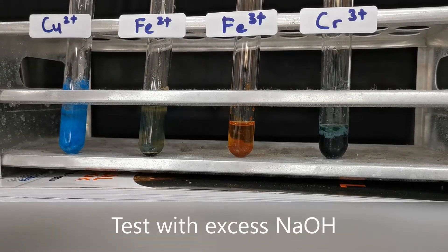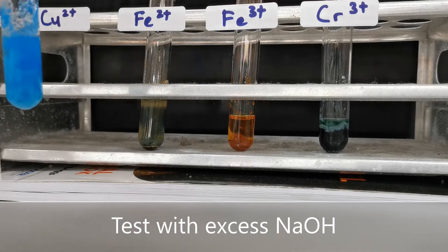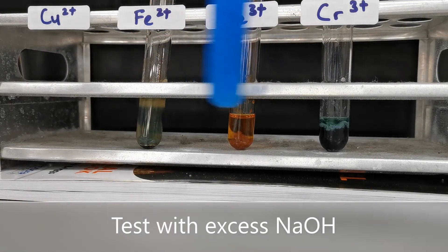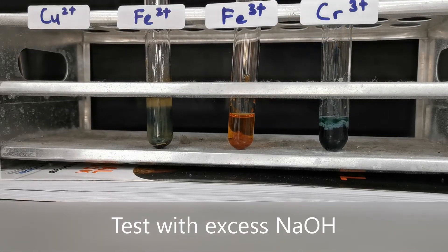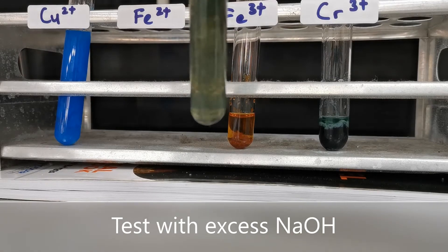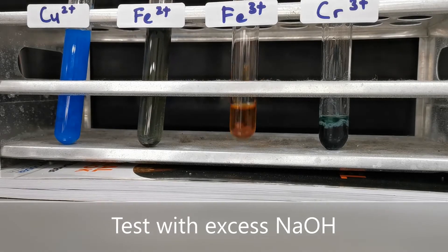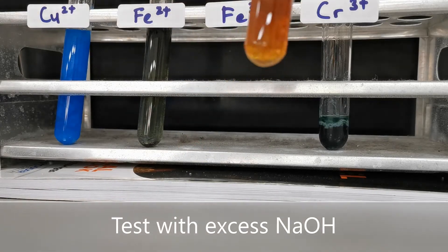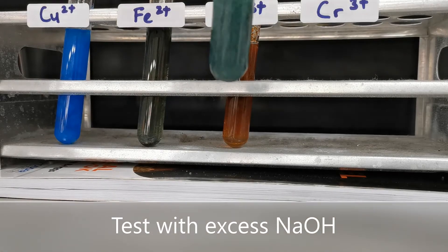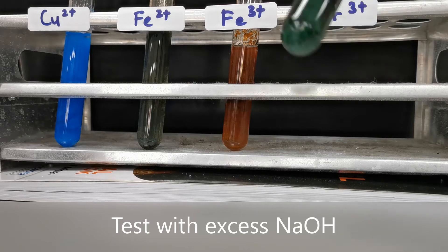Now let's add sodium hydroxide in excess and see if these precipitates dissolve. Copper hydroxide does not dissolve in excess sodium hydroxide. Iron(II) in excess sodium hydroxide also does not dissolve. Iron(III) in excess sodium hydroxide — the precipitate does not dissolve. For chromium(III) in excess sodium hydroxide, the precipitate dissolves to give a green solution.